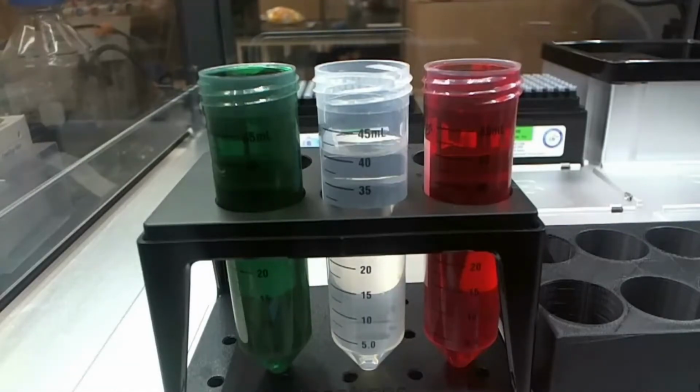We'll go into this later, but you can find this here. If you go into custom OT-2 functions.python, you'll see a big list of vial pipette offsets, right? Because we're using the 50 milliliter tubes, we're just going to take this string right here, copy it and paste it. Don't need to know what any of those numbers mean. We're just getting this thing running. Okay, so that's our source.